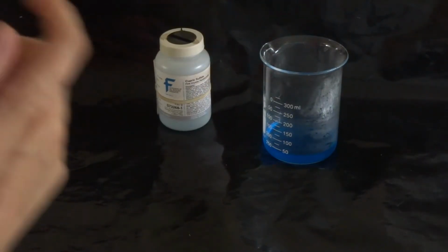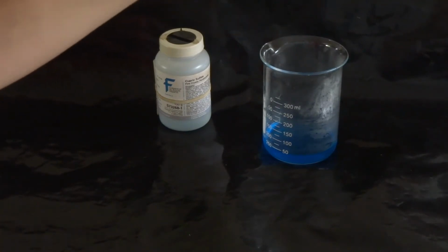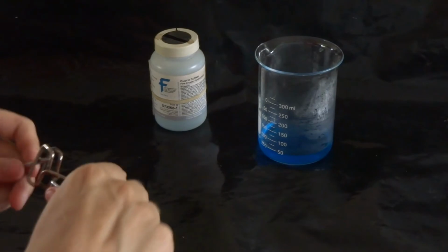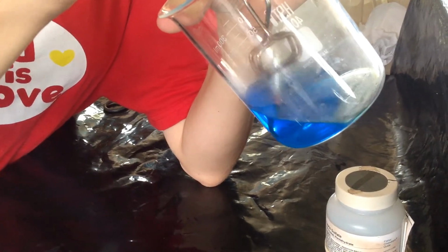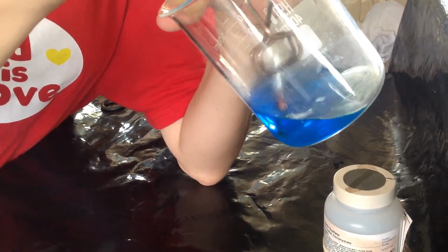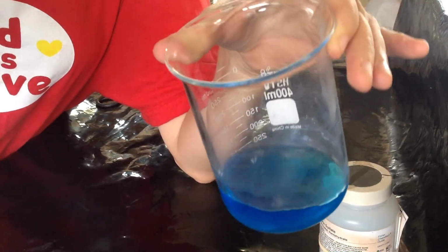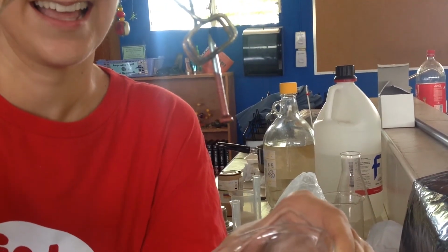We're going to be mixing it with iron. Here's my nail, hopefully made of iron. We'll find out in a moment. See what happens. And we've got an iron nail in there, and we are stirring. I can actually already see the reaction taking place. Check it out. Do you see that? Let's stir a little longer.